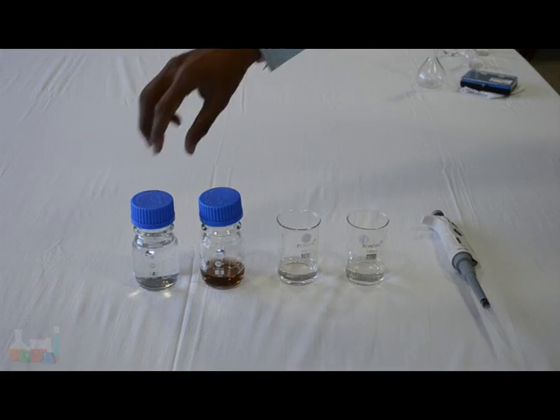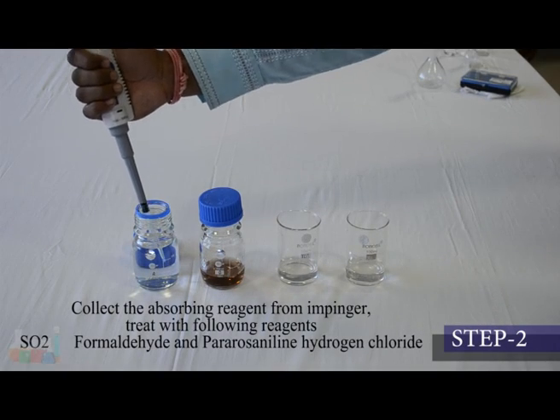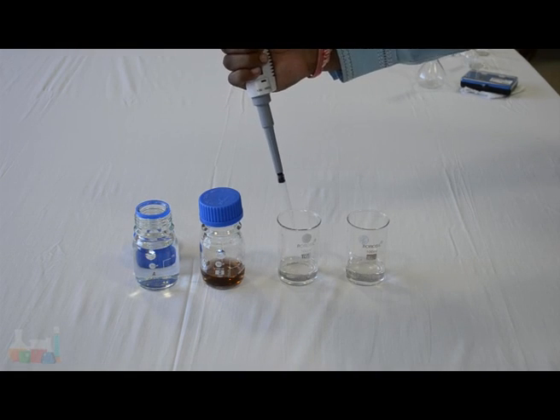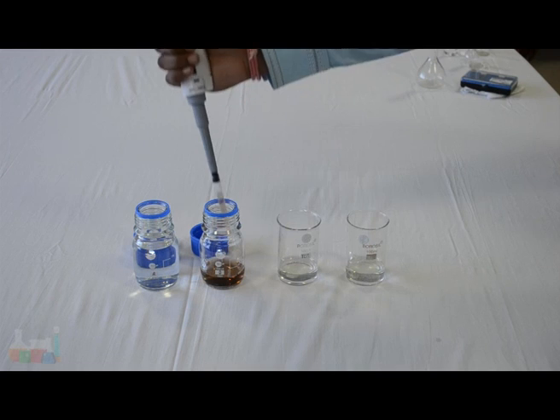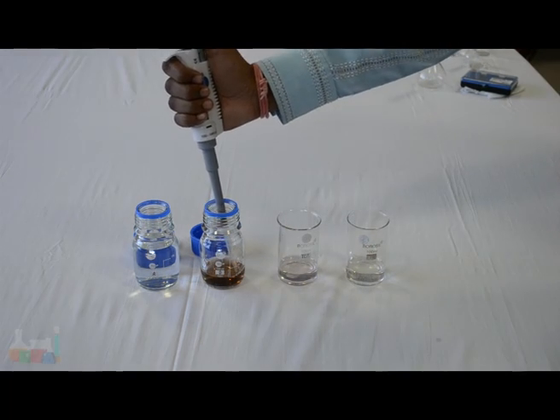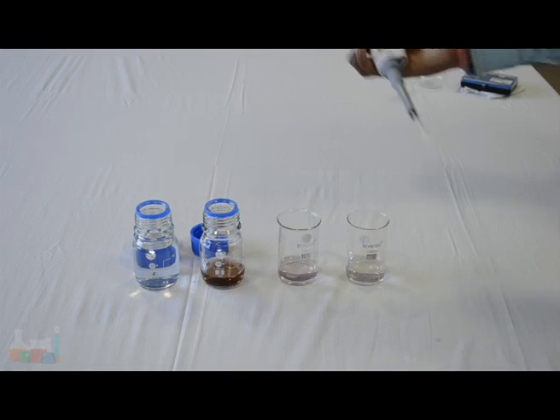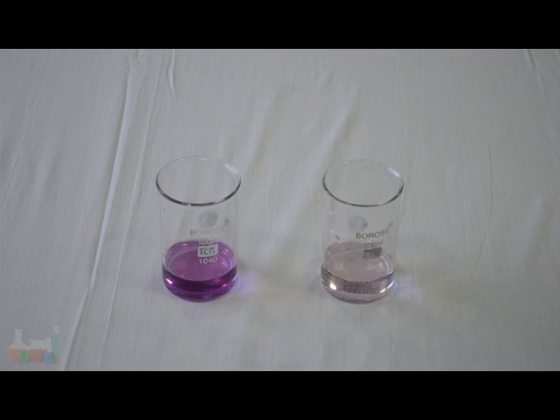Second step: color development of the impinger solution. 10 ml of impinger solution, which has absorbed a specific pollutant gas, is taken in a beaker. An appropriate amount of other reagents specific to that gas are added. By adding the same reagents to 10 ml of distilled water, a blank standard is made for each gas. Within 10 to 30 minutes, the color development takes place in the sample and standard beakers.